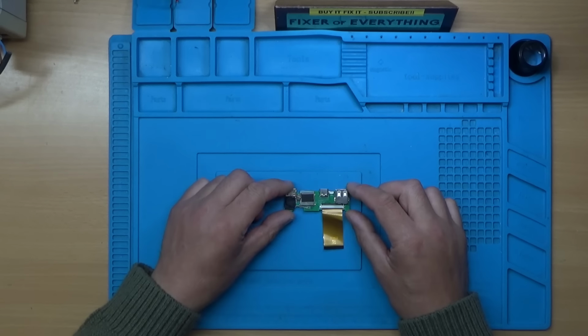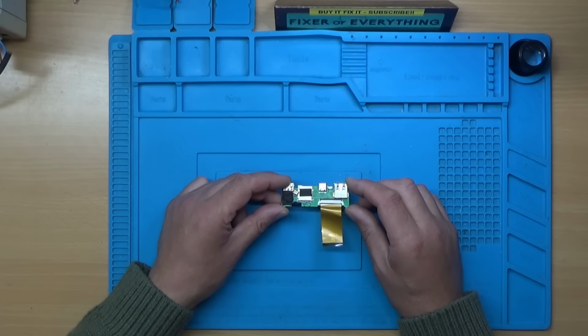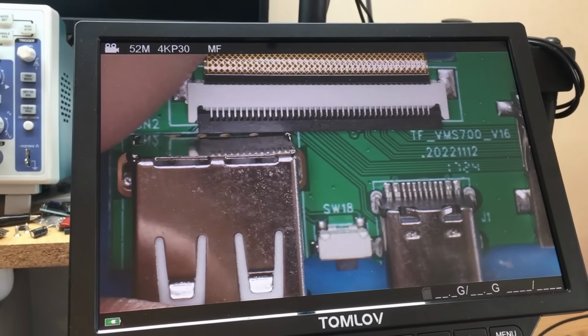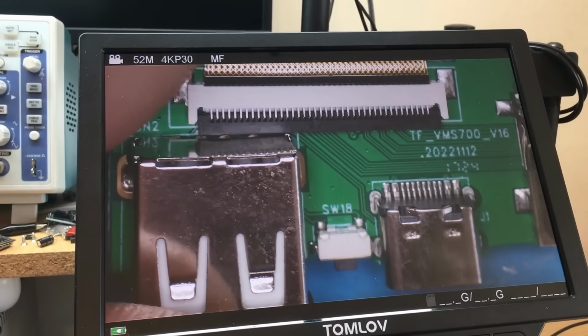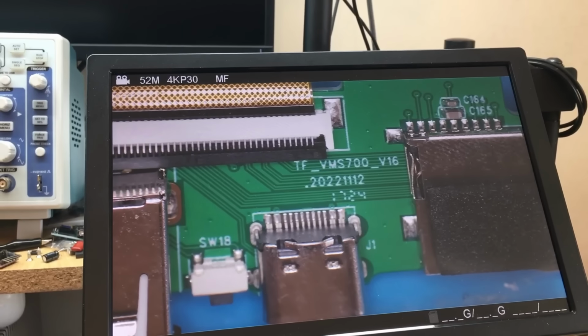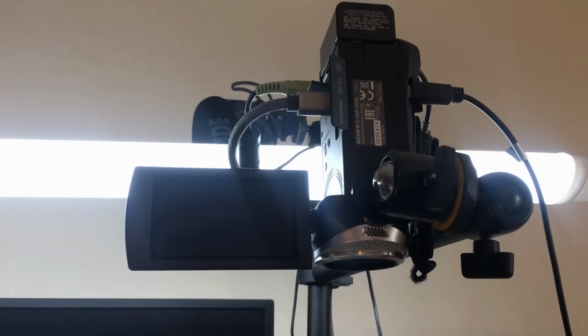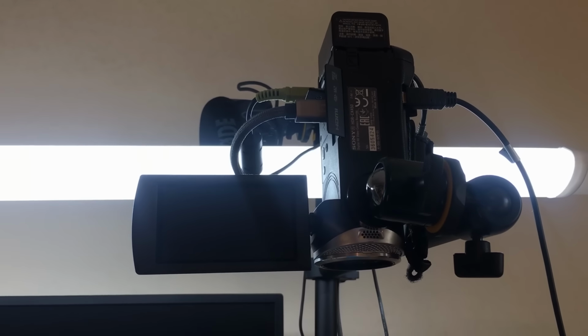Hi, so something a little bit different today. This is going to be a kind of product upgrade teardown video. I've been using my TOMLOV 4K-AF Max microscope for a while now, but one of the problems that I've got, which probably won't affect everybody, is synchronising the video with my overhead camera here. So I emailed TOMLOV and I asked would it be possible to add sound to this model.